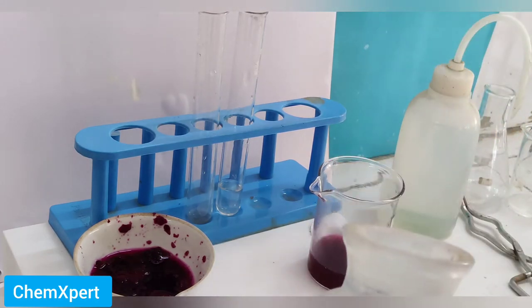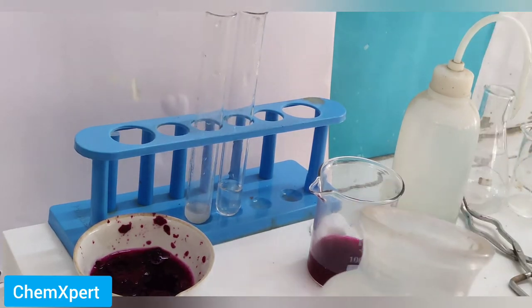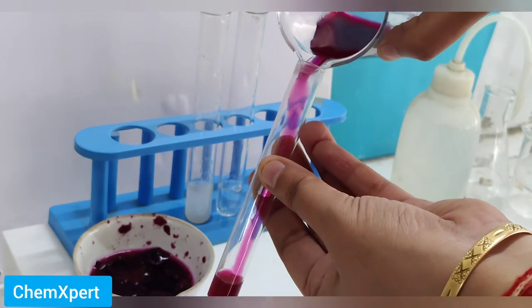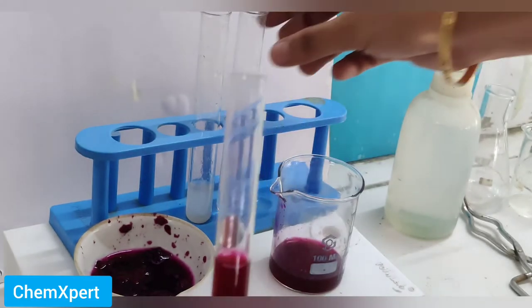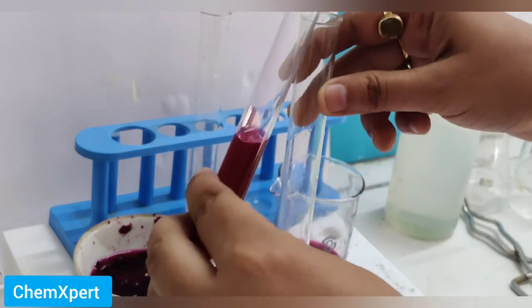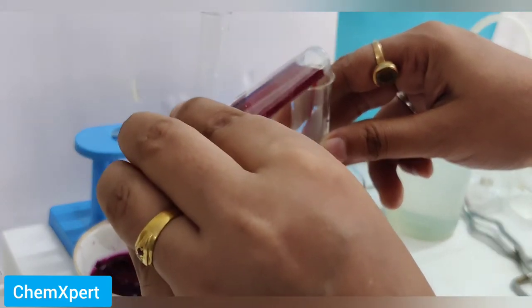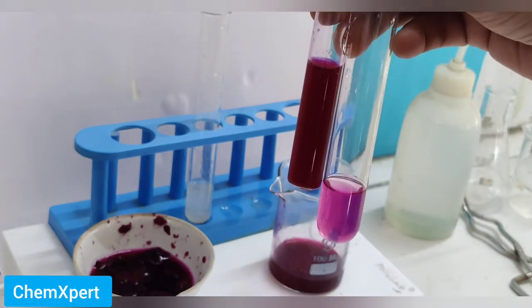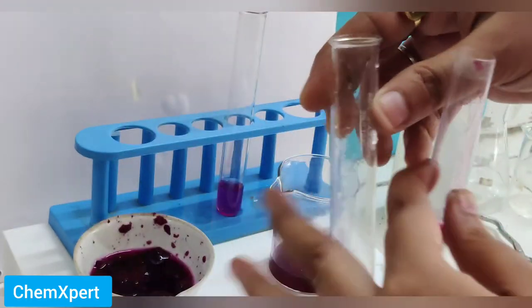In one test tube I have taken NaOH, that is sodium hydroxide. Now the next step is to add this beetroot solution to these two test tubes. First I will transfer a small amount of the indicator to the test tube containing acetic acid. You can observe the change — it changes into a slight pink color. Beetroot solution is a very dark solution, but in an acidic solution it becomes slightly pinkish.